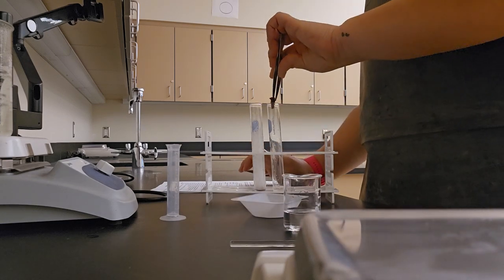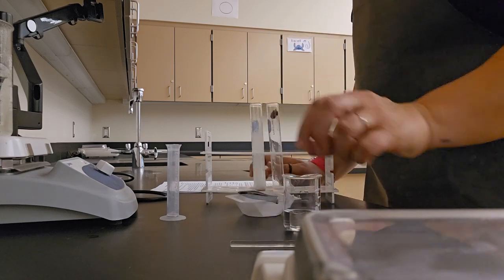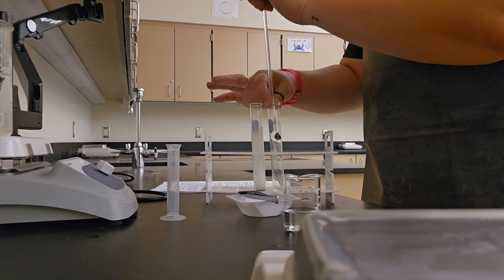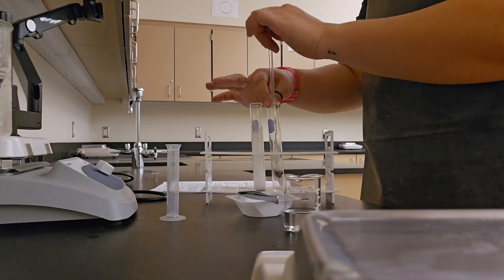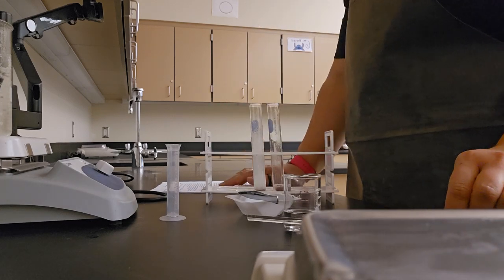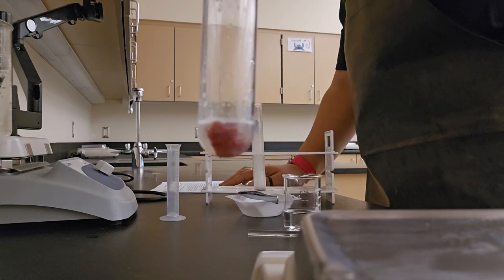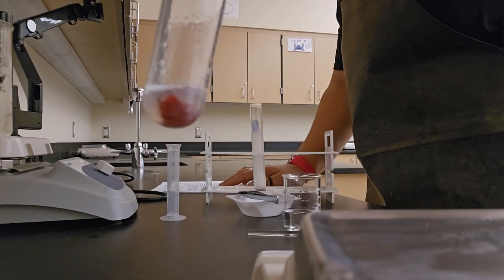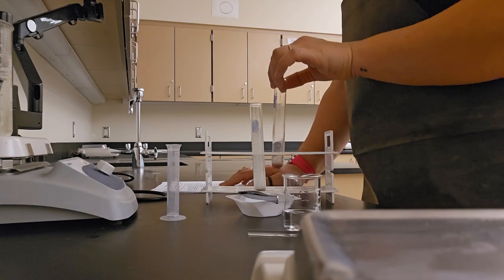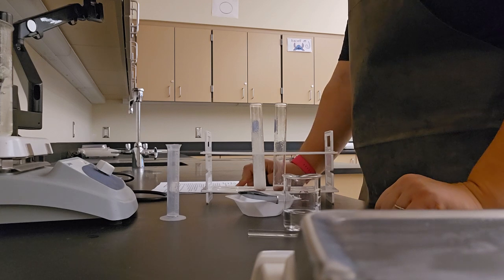So I've got my next piece. I'm gonna stick her in there and use my stirring rod to make sure it makes it all the way down to the bottom. And I observe what happens. This time, I've got a couple bubbles, but not really much of anything. So I could consider this a 0 or maybe a 1 to record in my data table under the new liver and used liquid column.